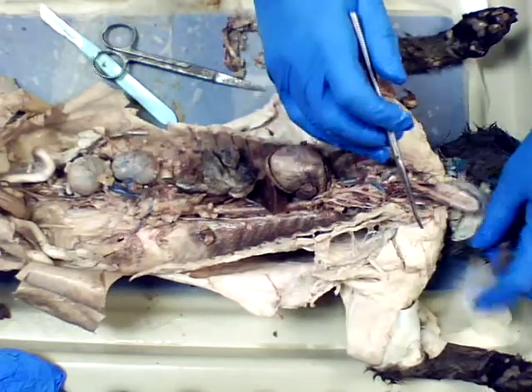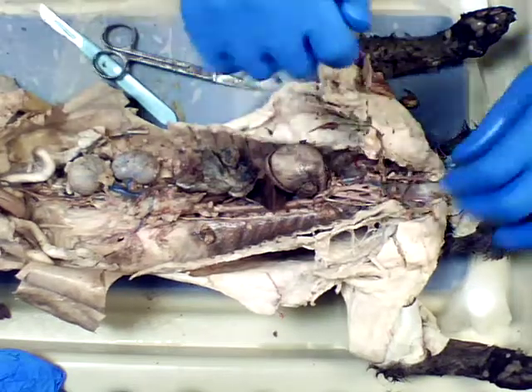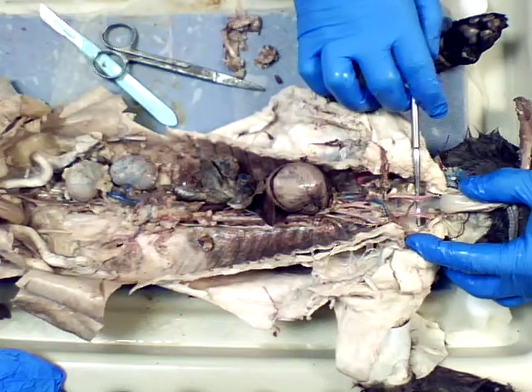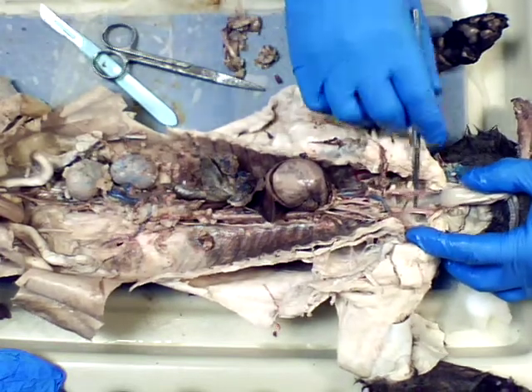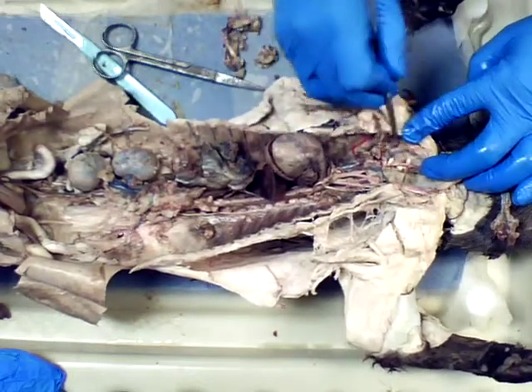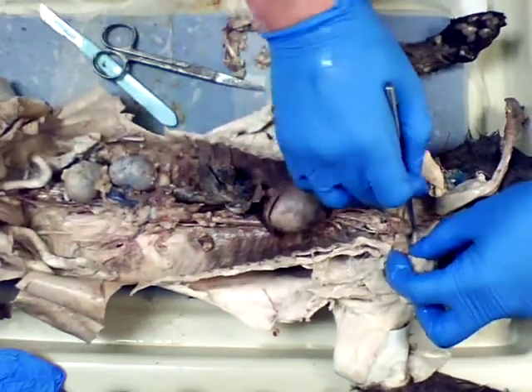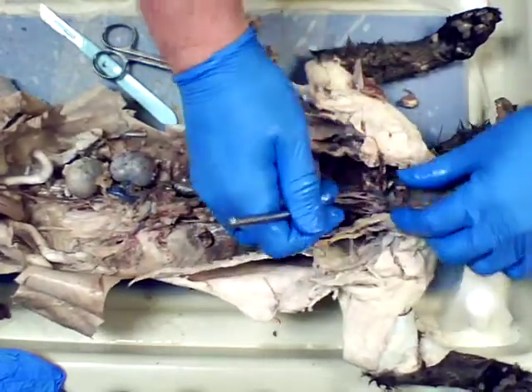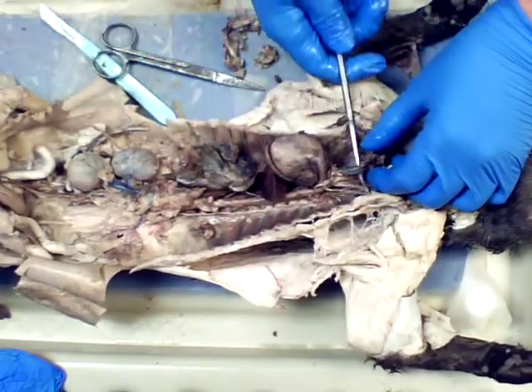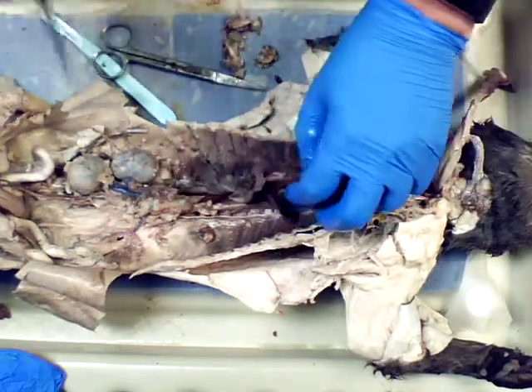Okay, so if I pull this esophagus out of the way as well, you can see here, there are the arteries leading to the head, and then coming back down, they're over here off to the side a little bit. You can see they're coming out of the arms, and they're up into the muscle tissue here coming out. So this is coming down, connecting to, again, what we would call our superior vena cava, the cranial vena cava for the cat. And we went through the path in the heart.